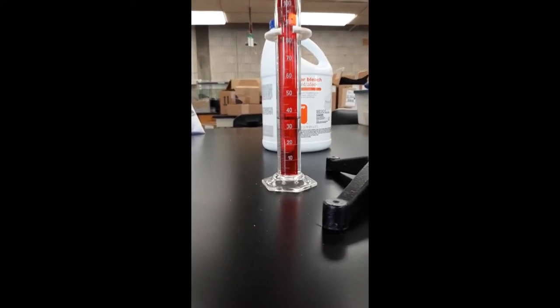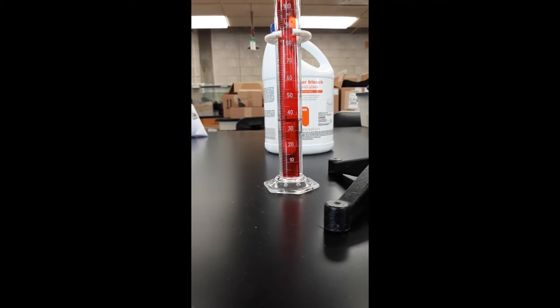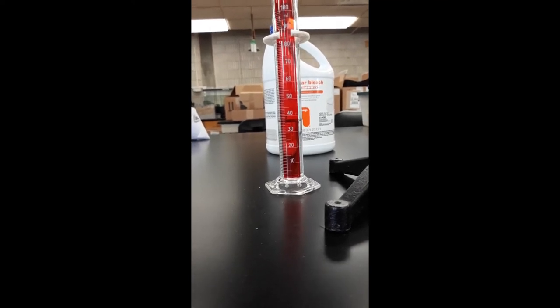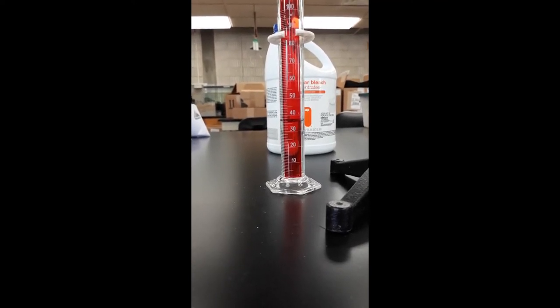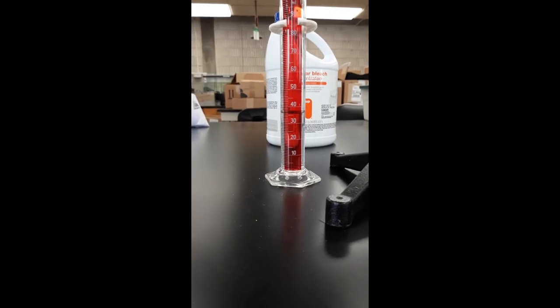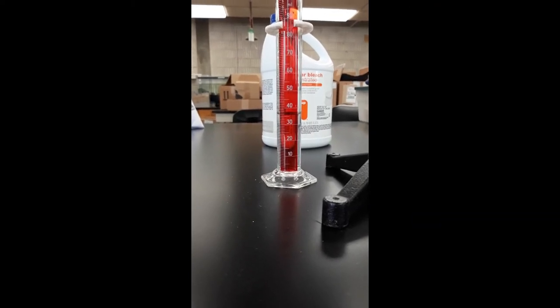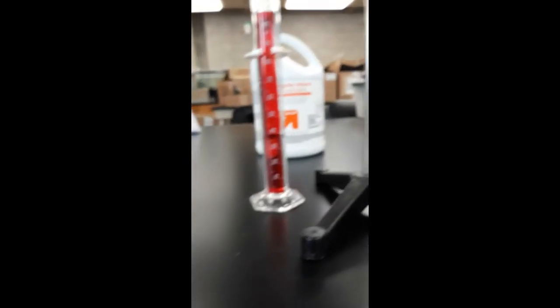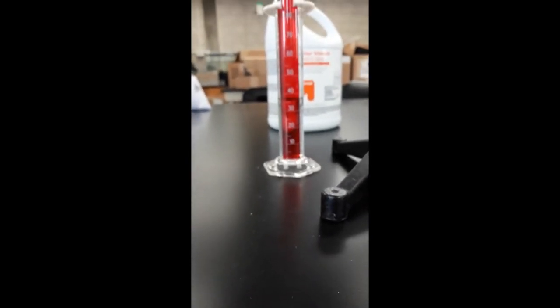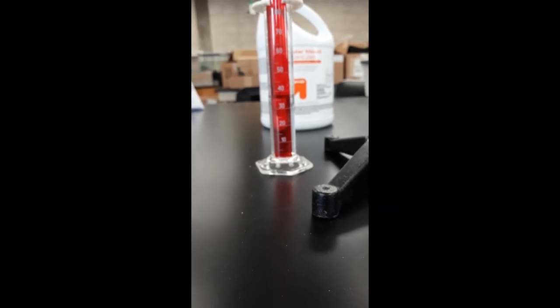Okay, so five minutes are up, so we can look at the level of water that's in there. Record your level and we'll go on to the next sample. This was with one mil of polymer.